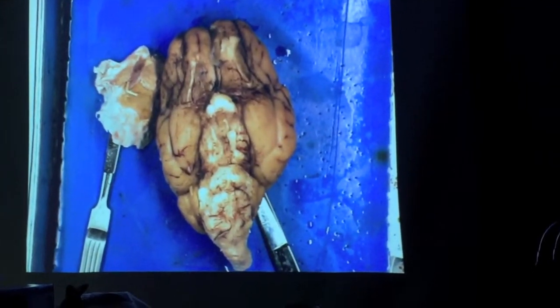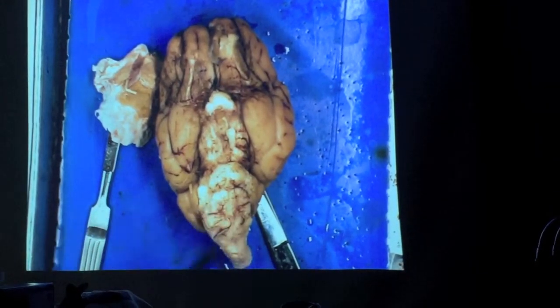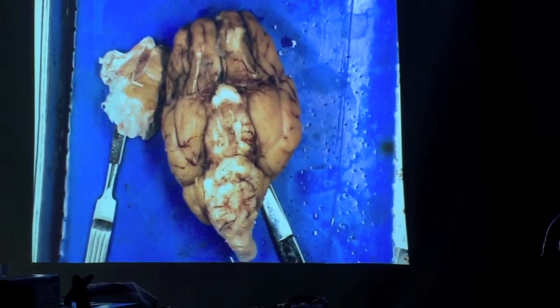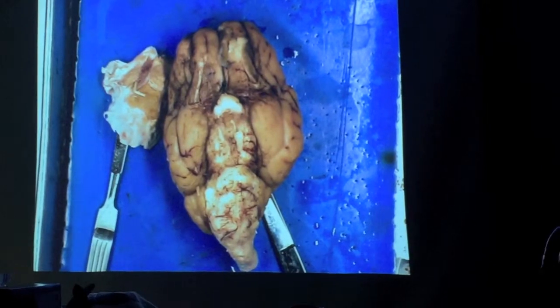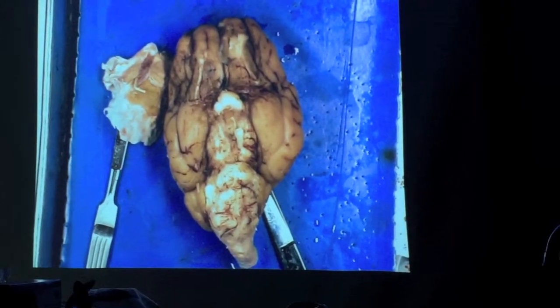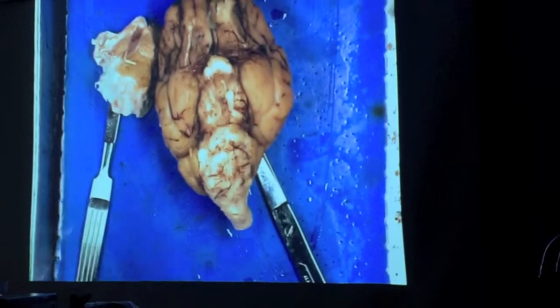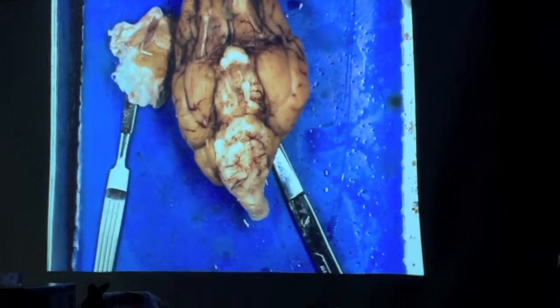pons. And then right behind them, we have this large sort of V-shaped structure, which would be the medulla oblongata, which also controls more autonomic functions, including it also has an impact on heart rate and respiration, along with other factors like digestive system activity and things like that. So a lot of the stuff that's happening that you're not consciously aware of, the pons and the medulla, either alone or together, are regulating that in various ways.